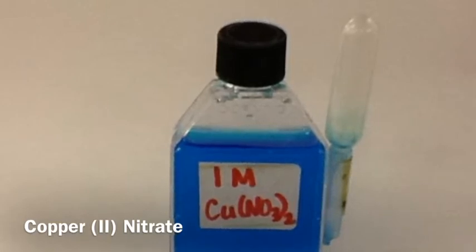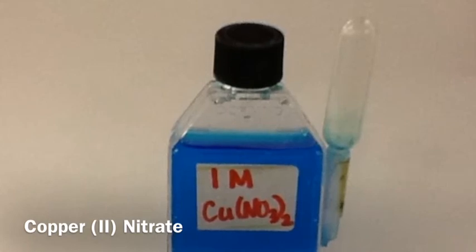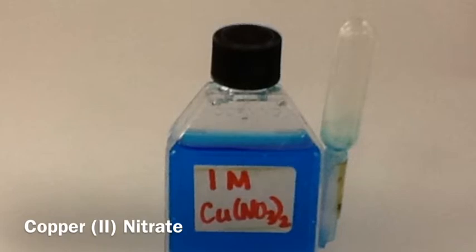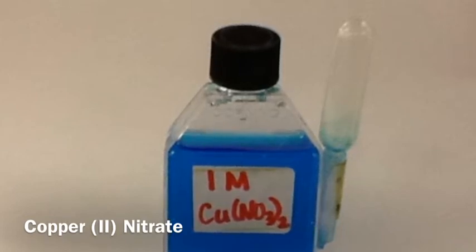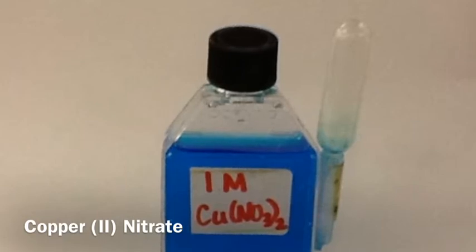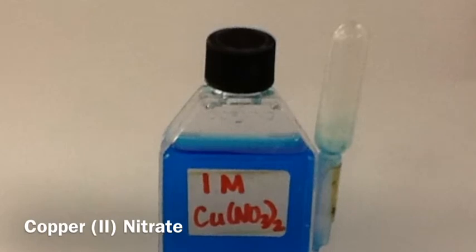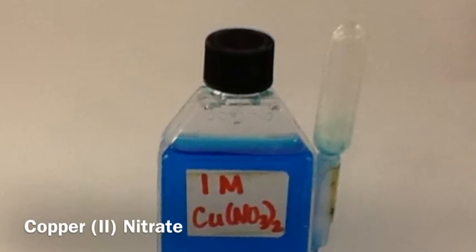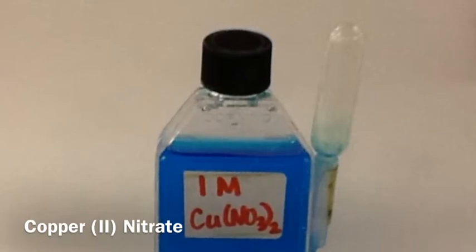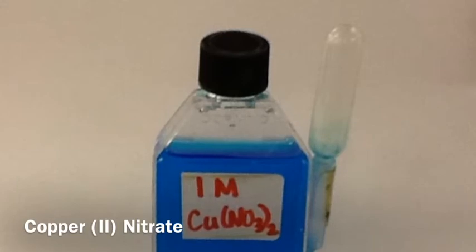Secondly, you should record the state. If you can see through it, it means that it's liquid. If you know there's a chemical dissolved in the liquid, then it's aqueous. If you can not see through it, it means that there's a solid precipitate. And if you see bubbles, that means that there's a gas. And for a couple of these reactions, you may see more than one of those states present at one time.